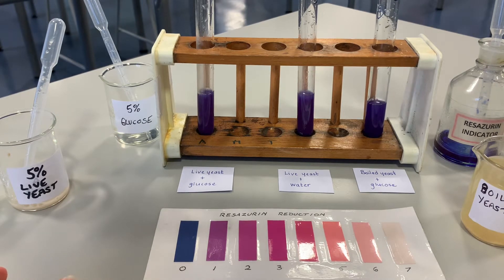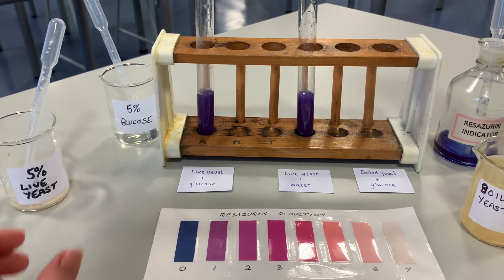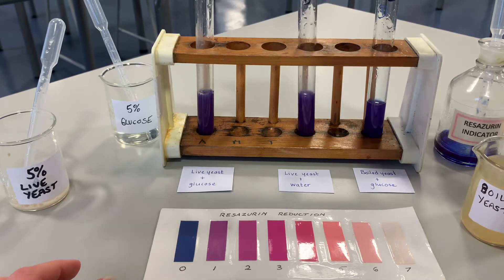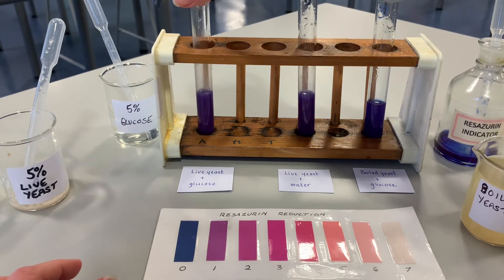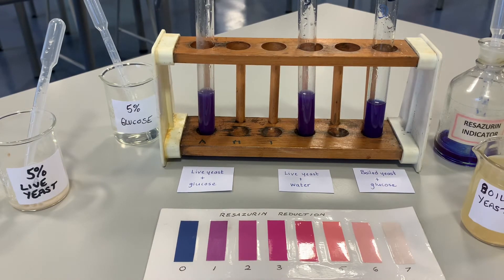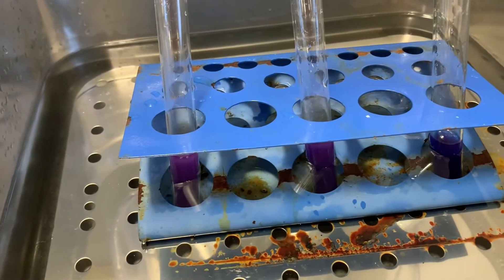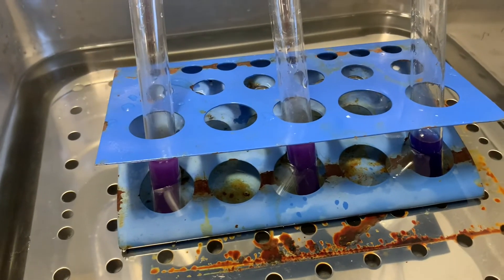We're going to add live yeast into test tube A, live yeast into test tube B, and boiled yeast into test tube C. Then I'm going to give them a shake just to mix the contents. The next job is to transfer them into the water bath and start the stop clock.